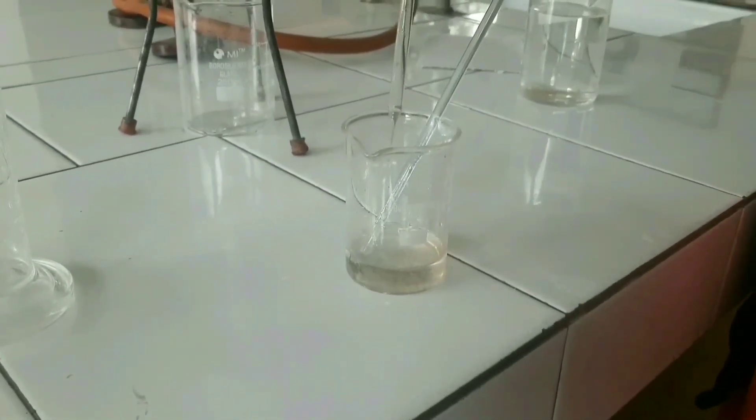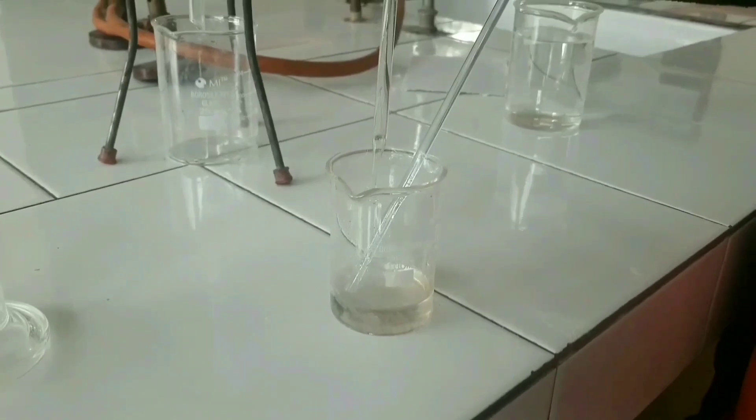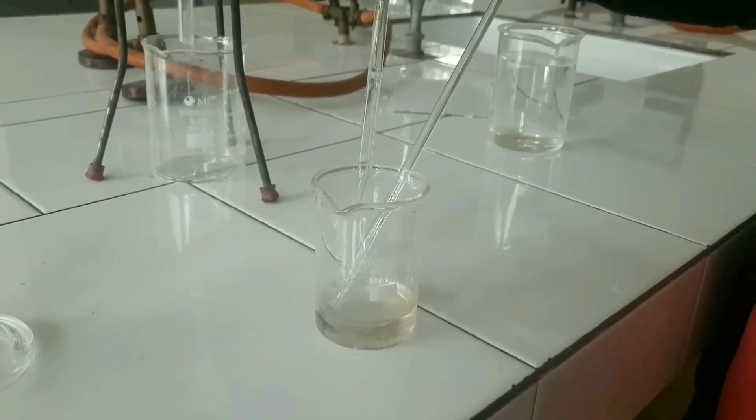Add sufficient water in small portions to the beaker to produce required quantity with vigorous shaking.